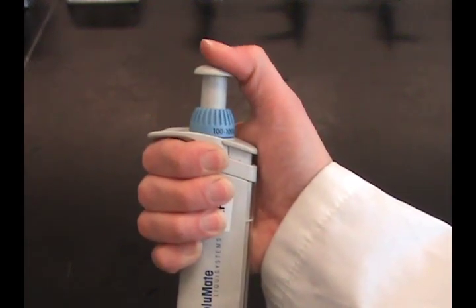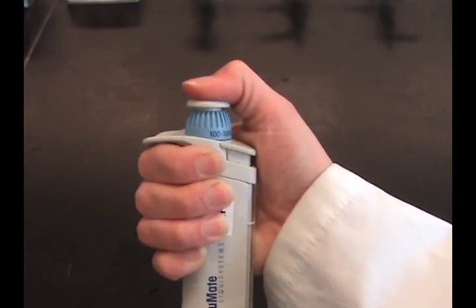Depress the plunger to the first stop. Do this with consistent speed, smoothness, and pressure.